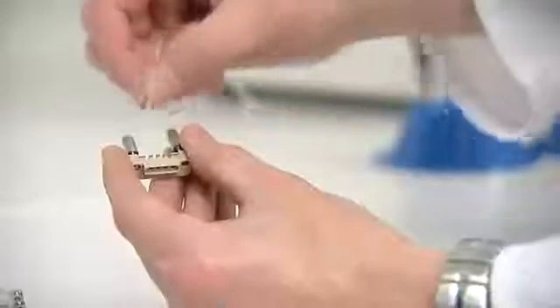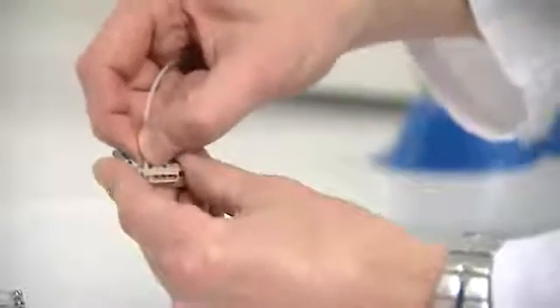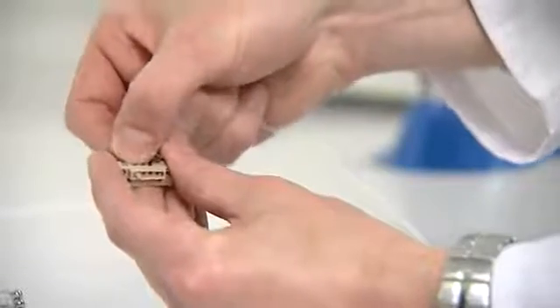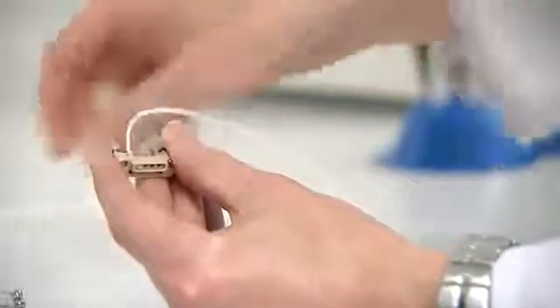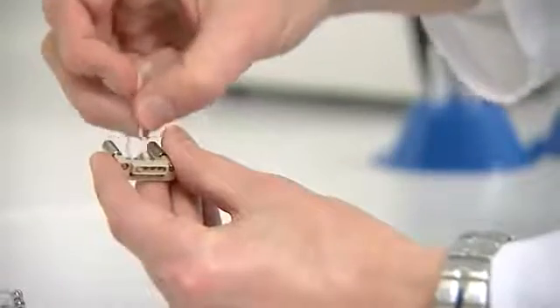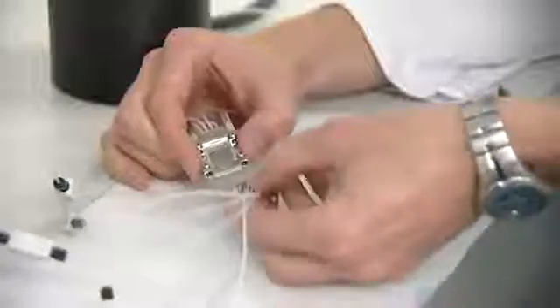First we connect tubing into a Dolomite edge connector. Each tube is pushed into the connector and then aligned and locked into place. This takes a few seconds and needs no tools.